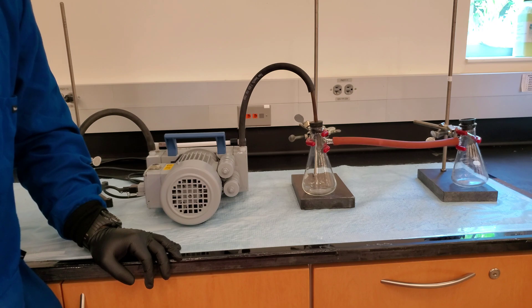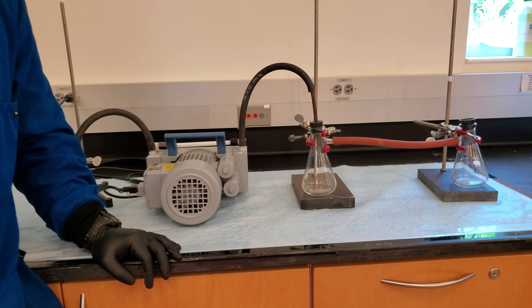When you are finished using the vacuum pump, disconnect the hose between your filter flask and the trap before turning the vacuum off. This is to prevent any unwanted chemicals and vapors from returning to the filter flask from the negative pressure in the system.